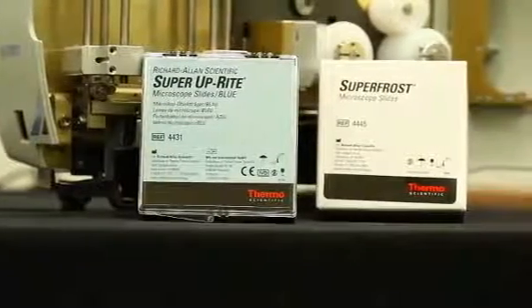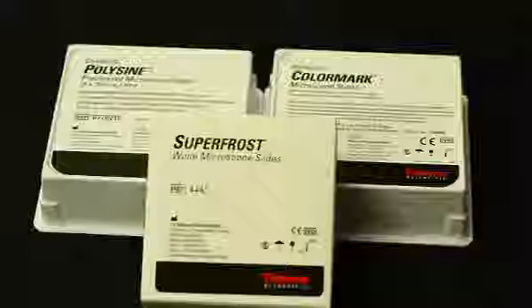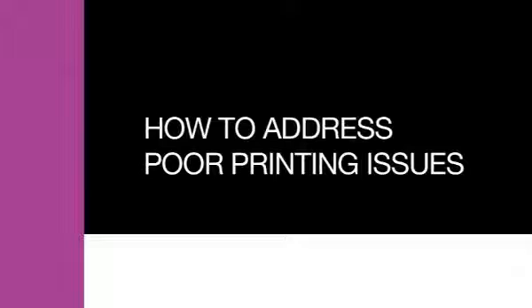Using optimized slides. Please be sure to use the optimized slides, as using optimized slides is recommended for best print quality and instrument performance. Rough slides will produce what is referred to as the orange peel effect, as the print will be rough, like an orange, rather than smooth. Using slides from the approved list of optimized slides will yield a smooth, readable print. For easy reference, this list is located in the back of the Thermo Scientific SlideMate Operator Manual, part number B81310009. How to address poor printing issues.